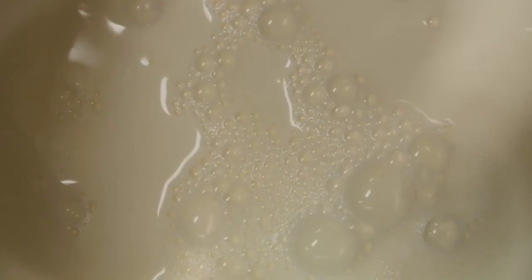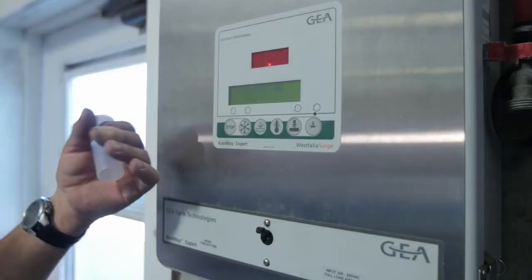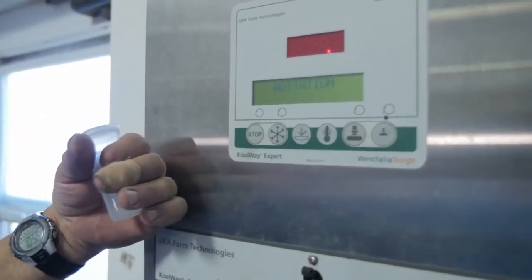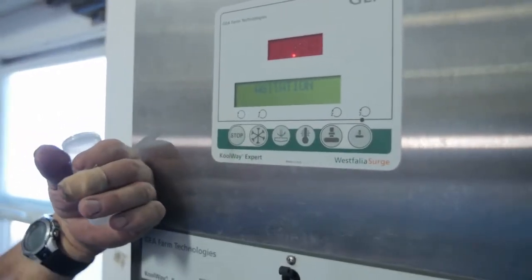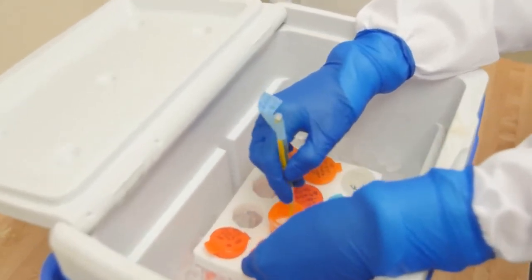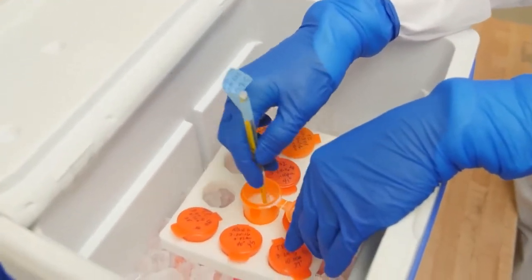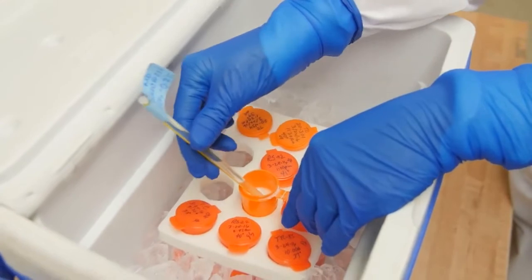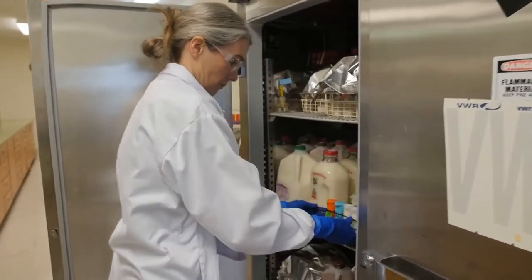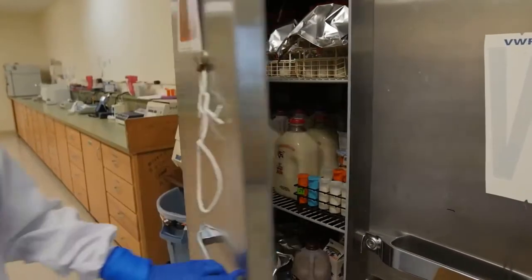However, somatic cells tend to rise to the surface with the butterfat, so inadequate agitation can lead to a falsely high somatic cell count. The age of the sample at the time it's tested in the lab can greatly affect both the bacteria count and the somatic cell count. Samples must be tested within a specific time from when the sample was collected at the farm.